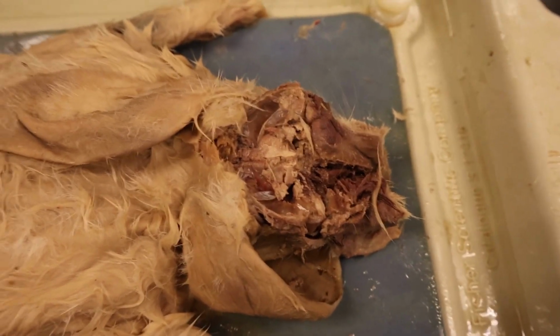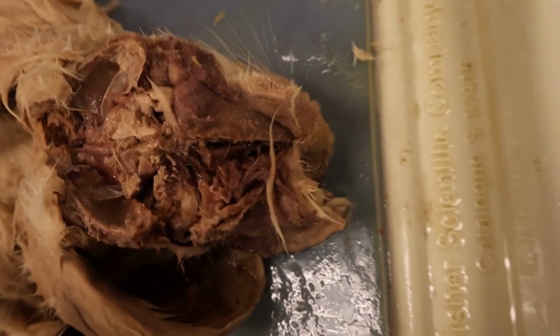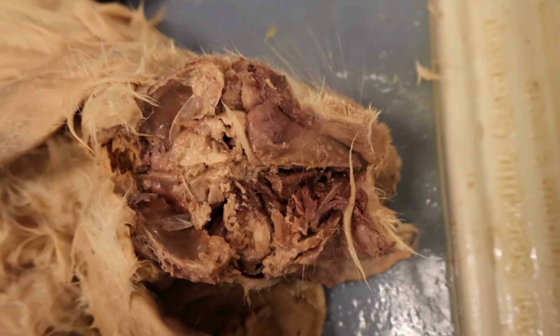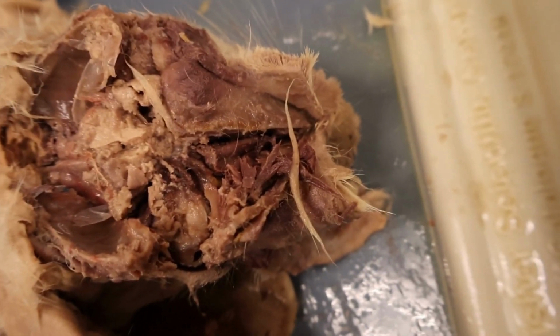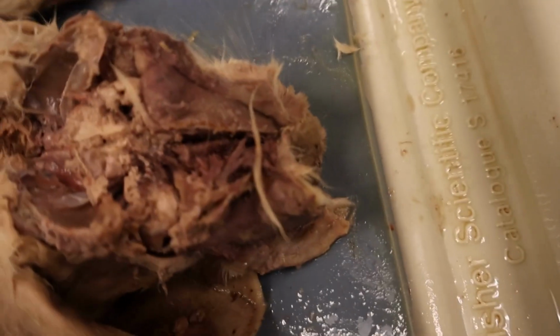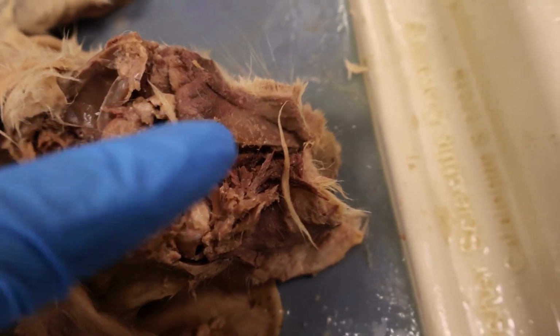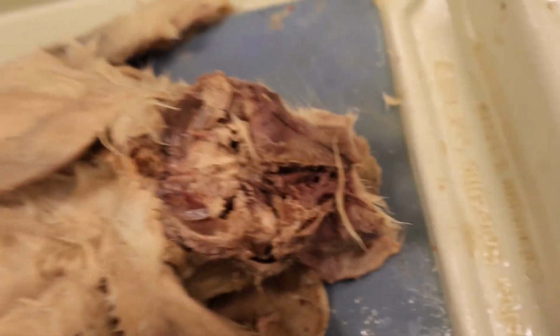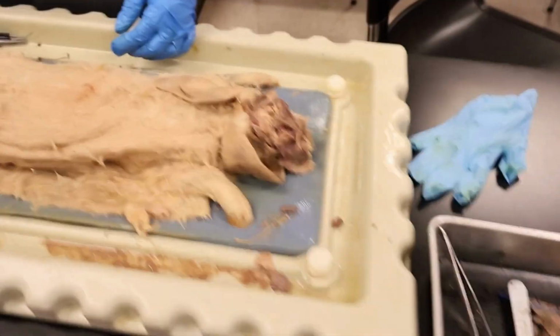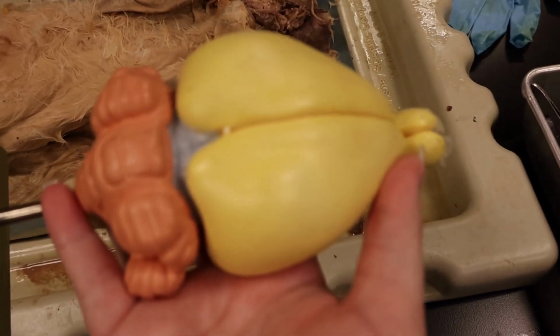Alright, so this is going to be our circulatory system continued. We did just get the bone saw and sawed four parts, or cross sections, into the skull. And so this is going to be a look inside the skull and at the brain. Right now it does kind of look like just some mushed up ganglia-like matter, but it is the brain right there, the brain structure. I did go over the brain a little bit more thoroughly, as what is shown in here is just made larger on the model right here.